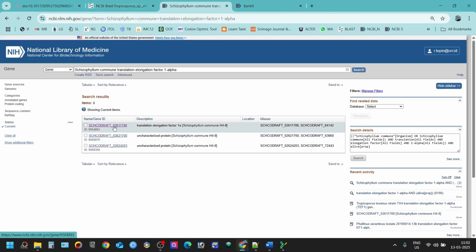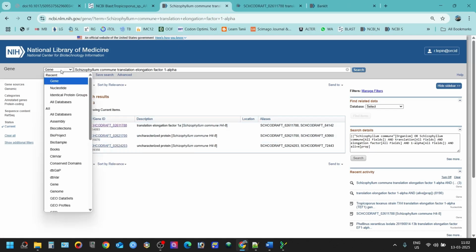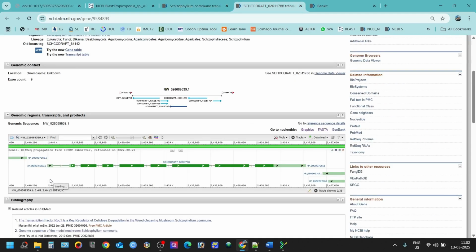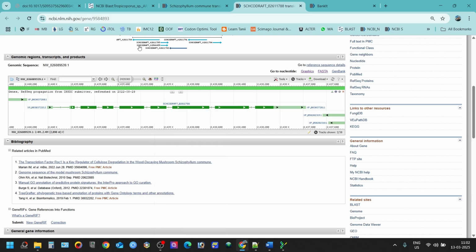So this is the sequence. Don't forget to keep this gene here. Don't just search this, press gene here and then Schizophyllum commune and search it, and you will find something like this, name slash gene ID. You can open it, and after opening, you will find this is your gene. You can see this is the translation elongation factor 1 alpha gene of the species Schizophyllum commune.